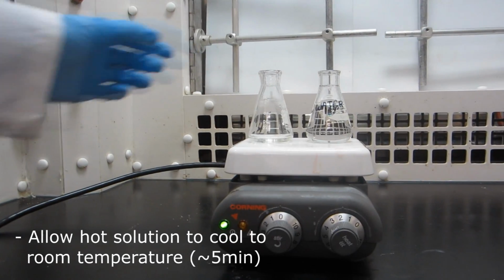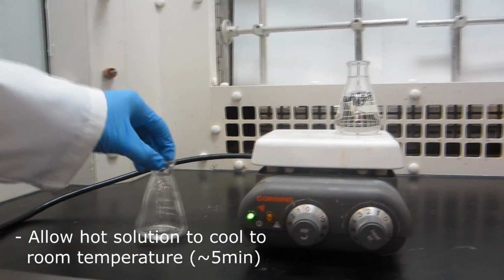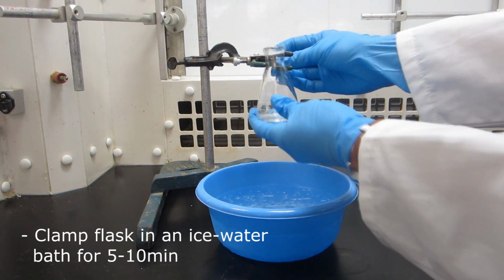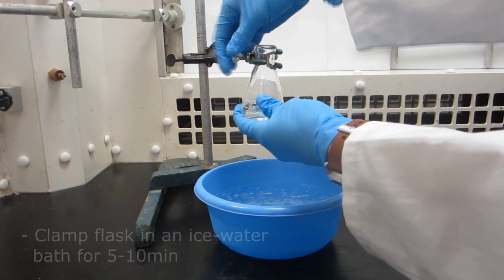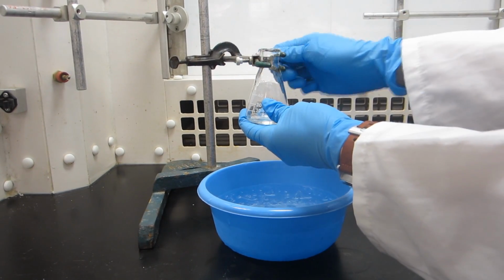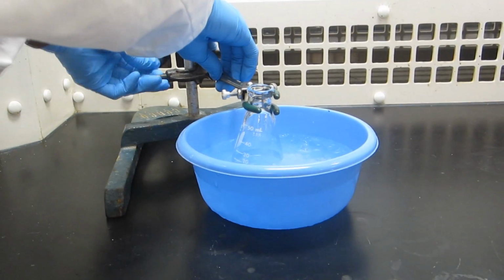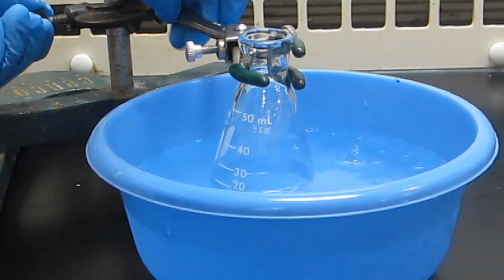Allow the hot solution to slowly cool to room temperature for about 5 minutes. Then clamp the flask in an ice water bath for another 5 to 10 minutes to allow the pure compound to crystallize. Patience is important in this step in order to obtain pure compound.